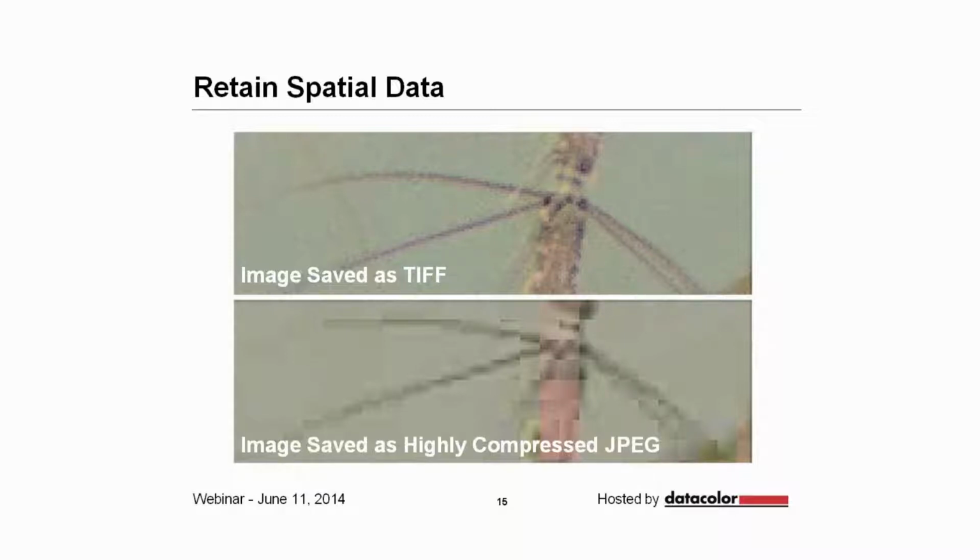In this instance, you can see that the top image was saved as a TIFF image, which doesn't throw away any kind of visual data, but the image on the bottom was saved as a highly compressed JPEG. And as you can see, the data has been removed. Much of the spatial data has been removed.